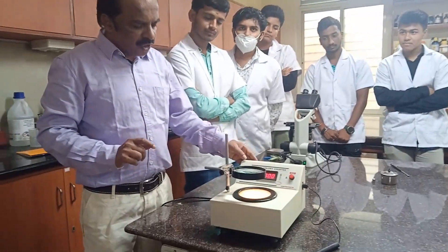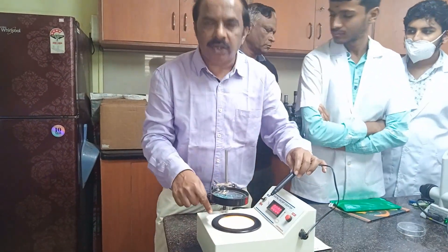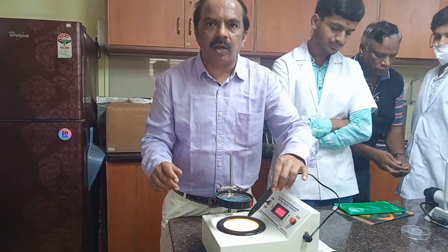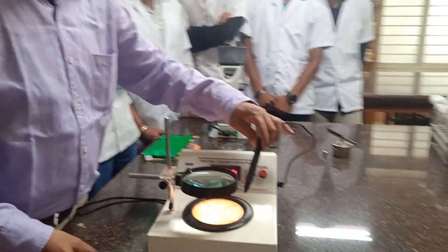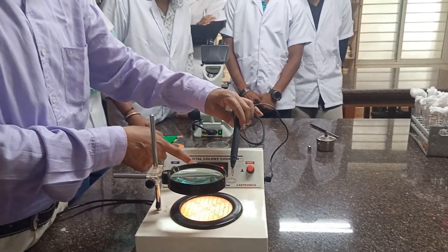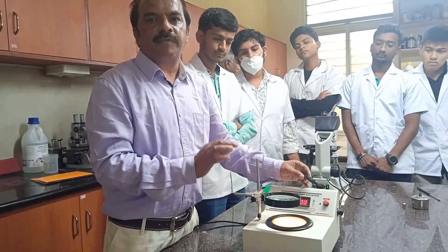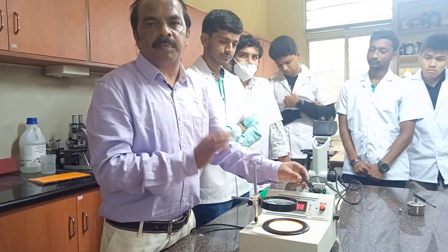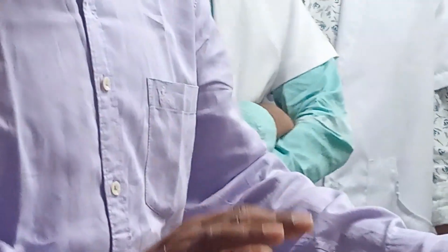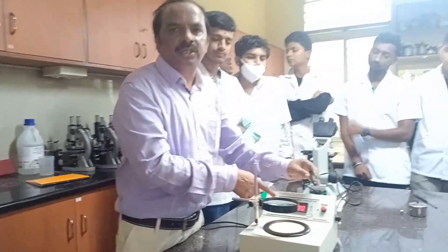As you look through the magnifying lens, you can start counting. You use this pen — once you touch a colony with the pen, it is counted, and that count is displayed on the screen. This is the digital colony counter. How many colonies are formed in a bacterial culture can be counted without any problem, and the count is digitally recorded and displayed on the screen.